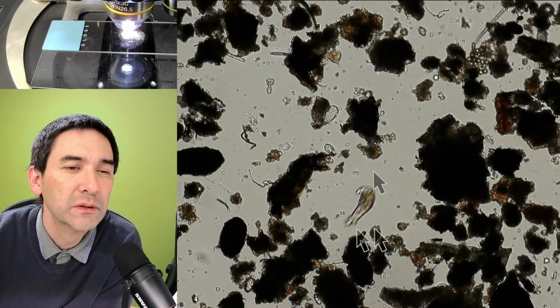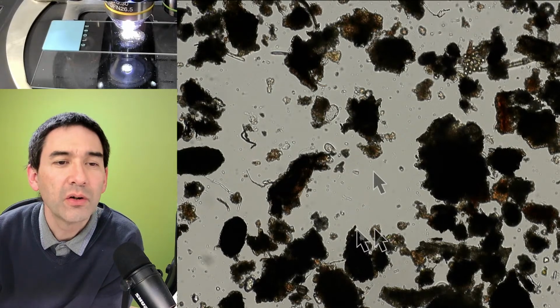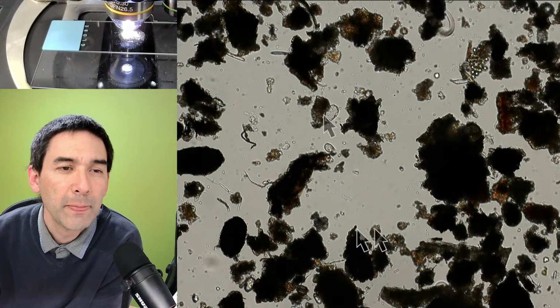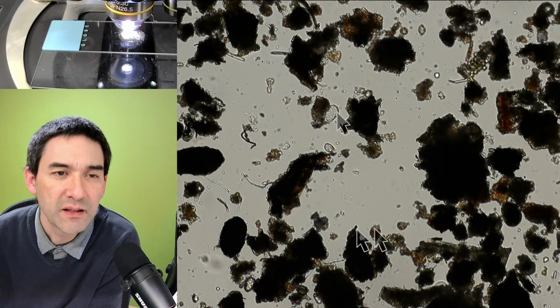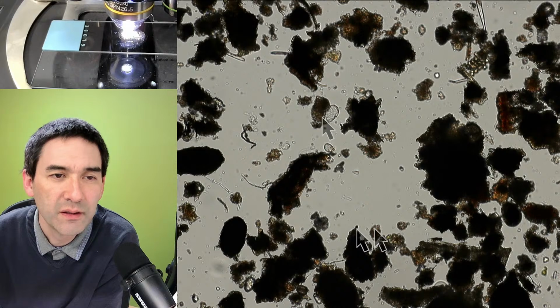And another thing that I would like to show you, these things here are the so-called tests of amoeba. A test is a shell, like a structure, and this one seems to be an empty test. The test basically from testate amoebae. These are amoebae that basically have this shell around it.